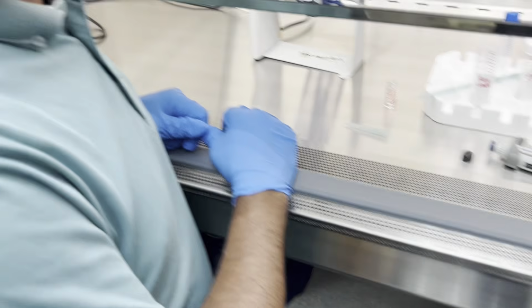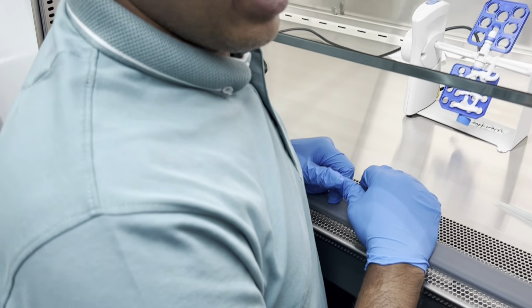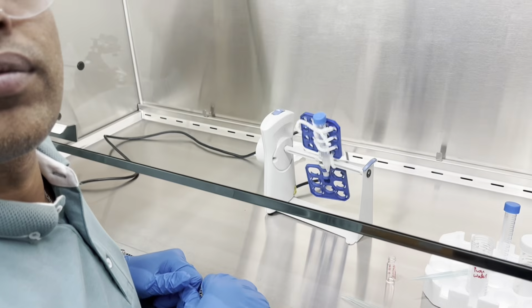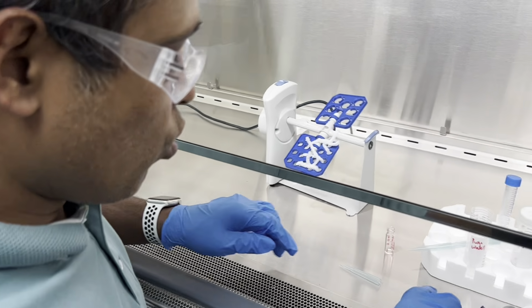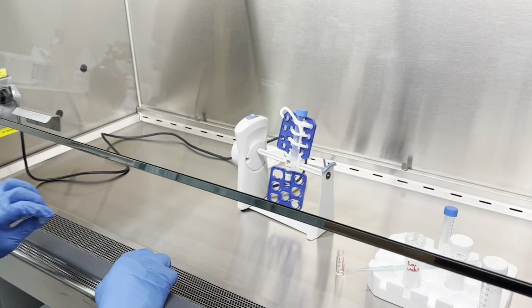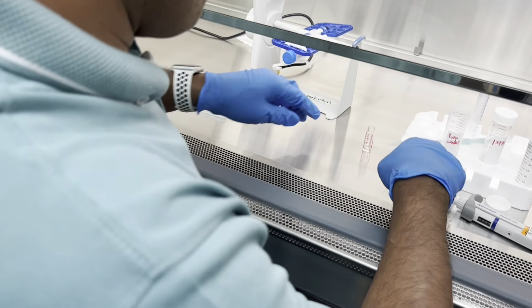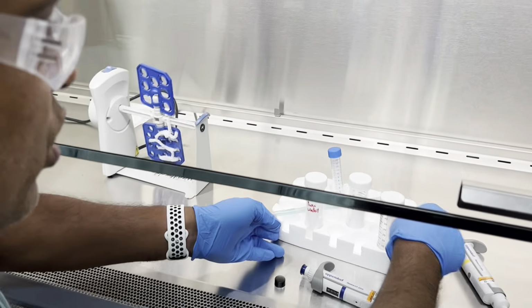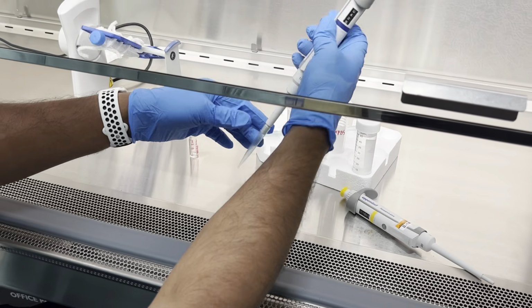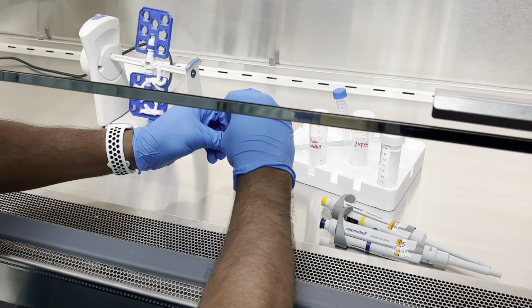PBS solutions. So we're gonna have two different tubes in the end, right? Because we're splitting them. Yes. Some will be BSA, some will be CRM. And we're doing them simultaneously, in parallel. Yes. Oh, one thing we can do, we can leave those things here, because in that case we don't need to do cleanup again.